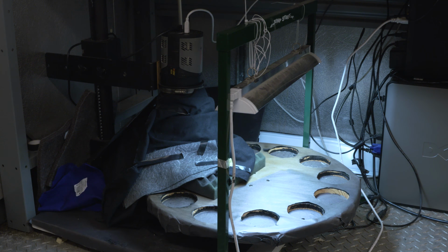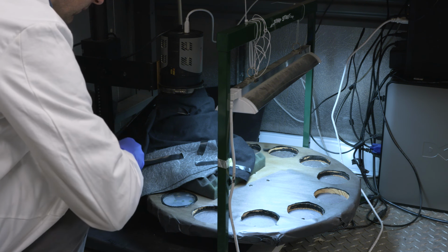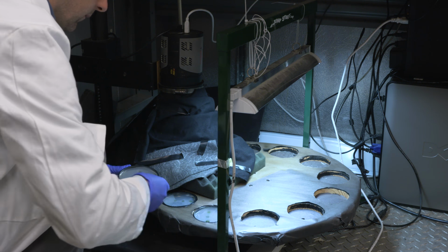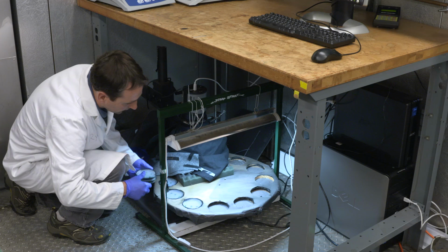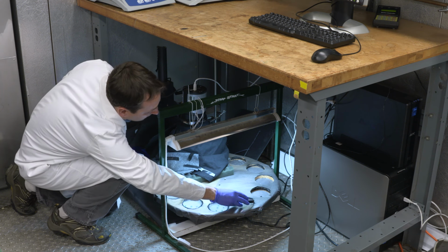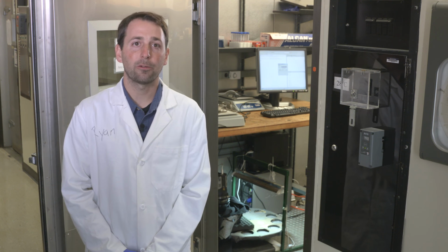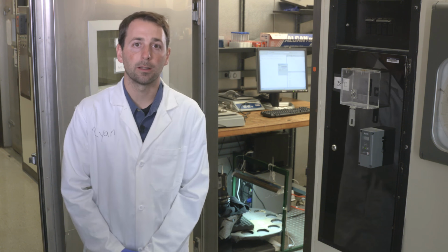Agar plates containing our samples will be placed on the turntable, where cutouts have been made to specifically hold the plates. 9 plates can be accommodated during each experiment. Overhead, you will notice a light source that will keep our samples in constant lighted conditions for the duration of the experiment. This is important because cyanobacteria require light to continue growing.